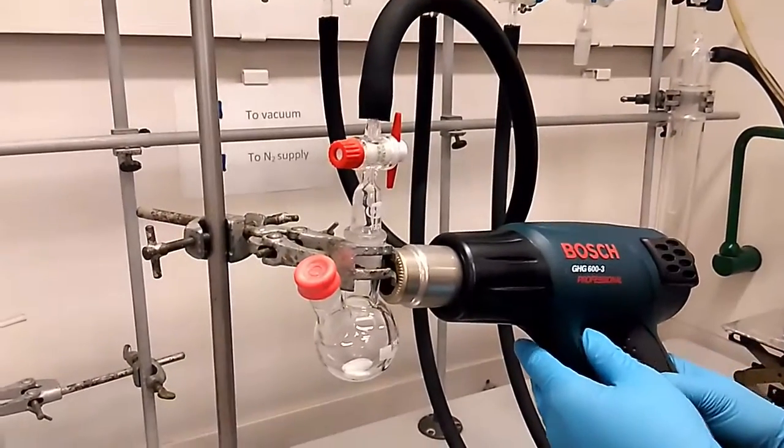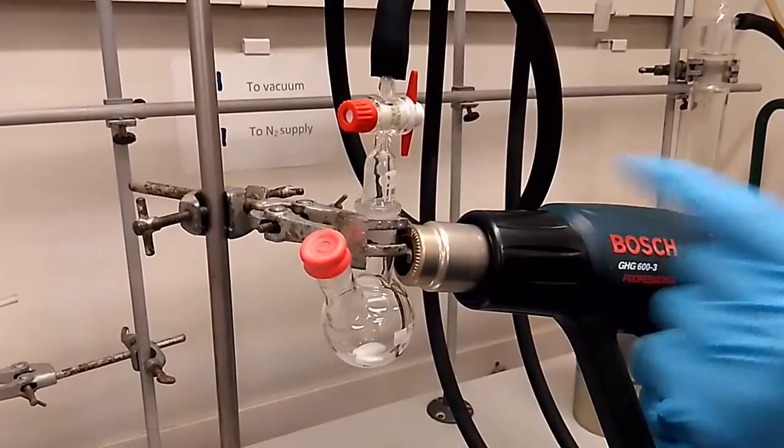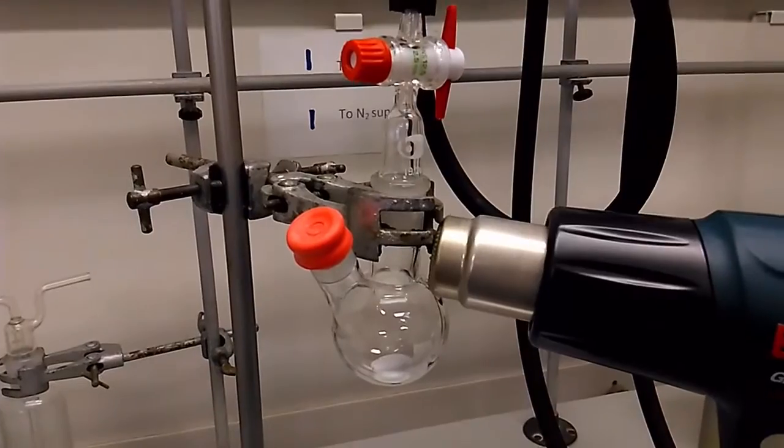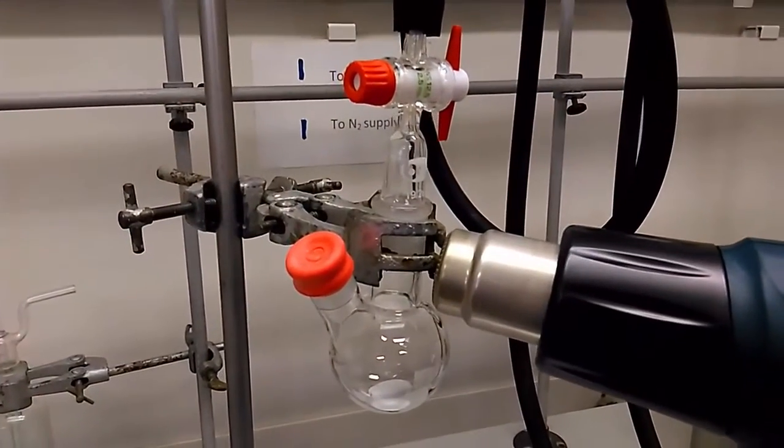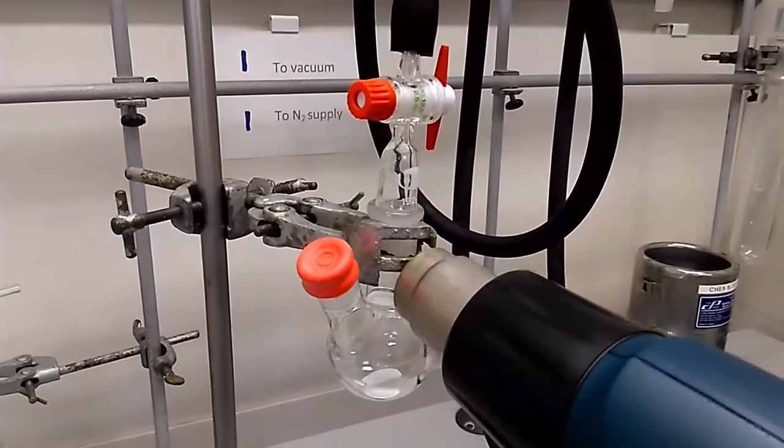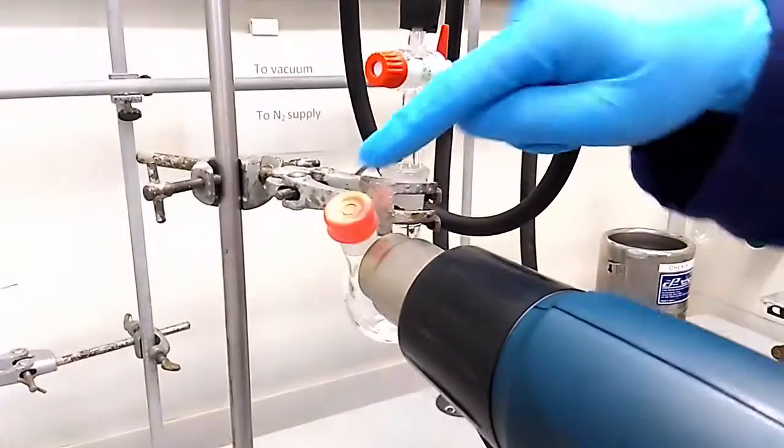Move up slightly to the neck of the round bottom flask. And you can go up a bit higher.